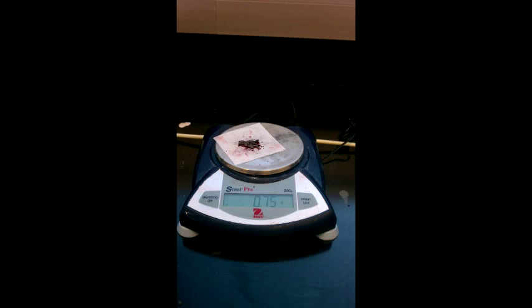When calculating the mass of the actual yield, do not forget to subtract the mass of the boiling chips from the final mass to solve the mass of the actual yield.